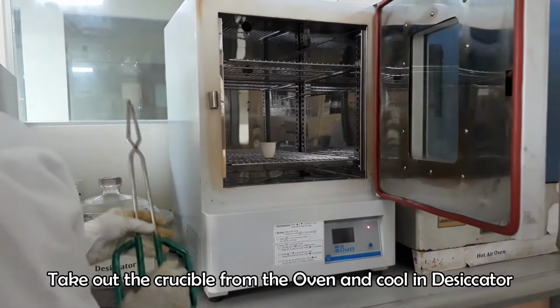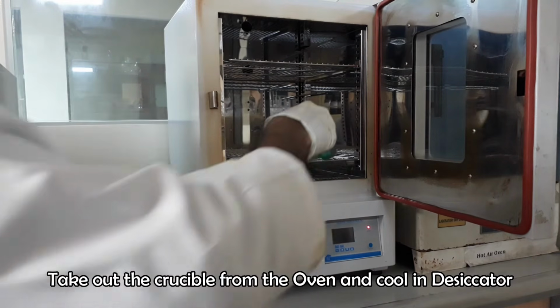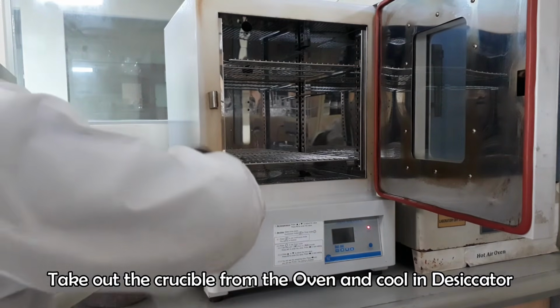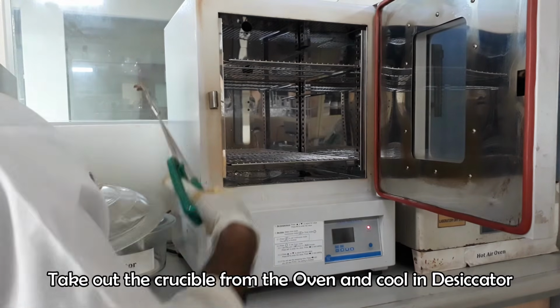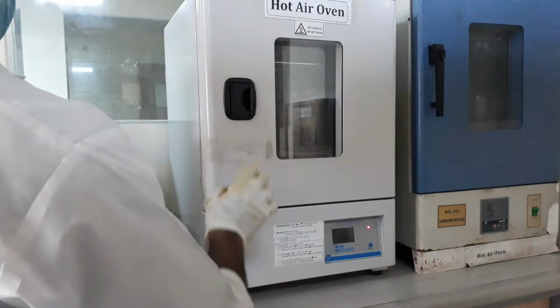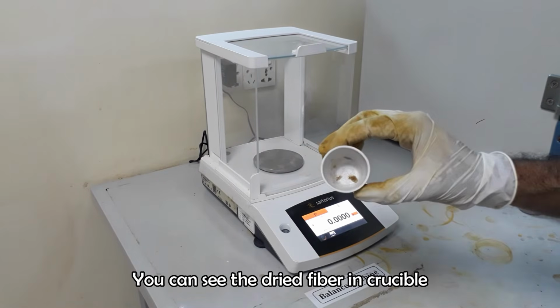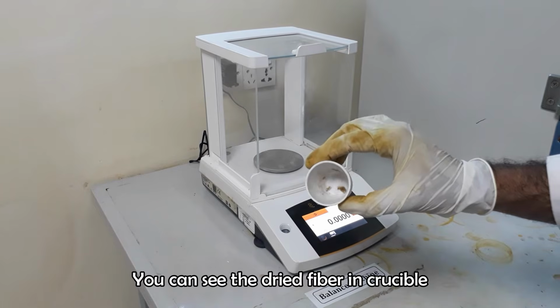After drying, take out the crucible from the oven and cool in a desiccator. You can see the dried fiber in the crucible.